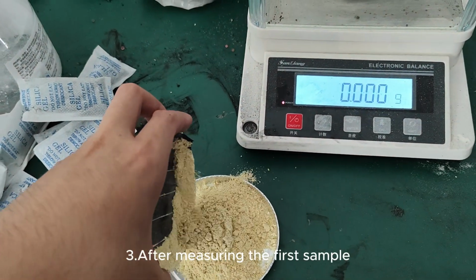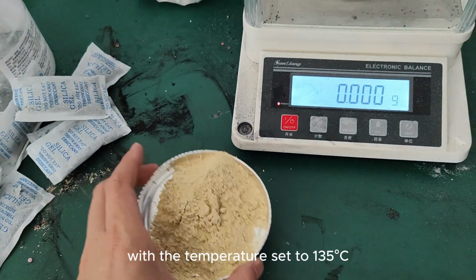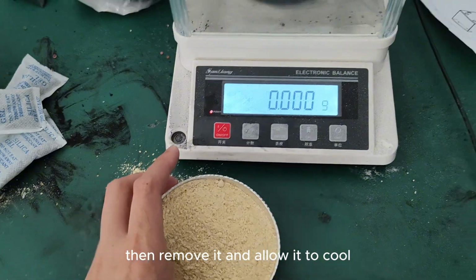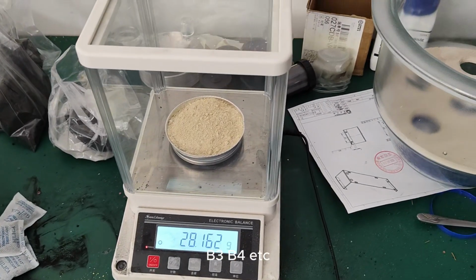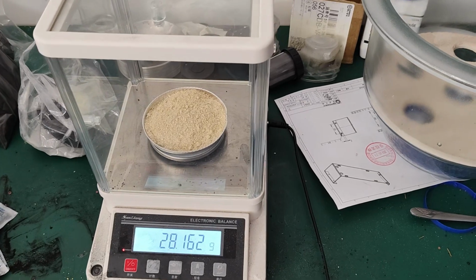3. After measuring the first sample, place it in an oven with the temperature set to 135 degrees Celsius. Dry the sample for 2 to 3 minutes, then remove it and allow it to cool. Repeat the weighing process, recording the weights as B2, B3, B4, etc. It is recommended to record 8 to 10 measurements.